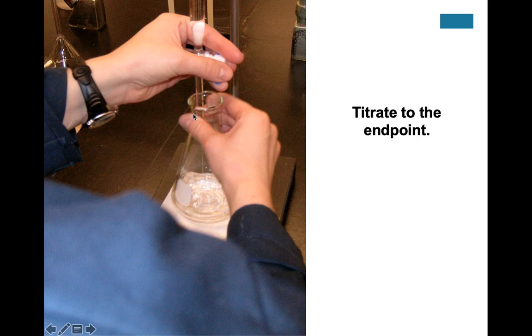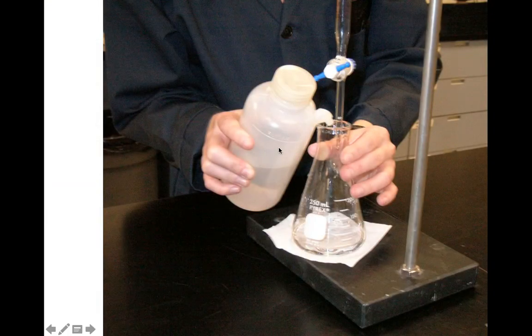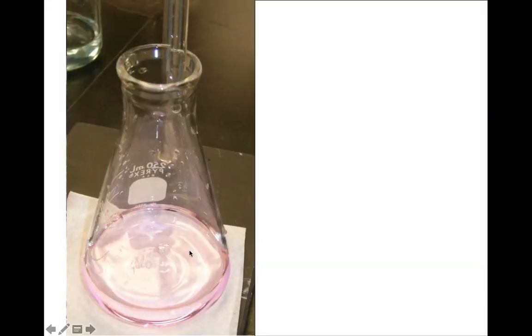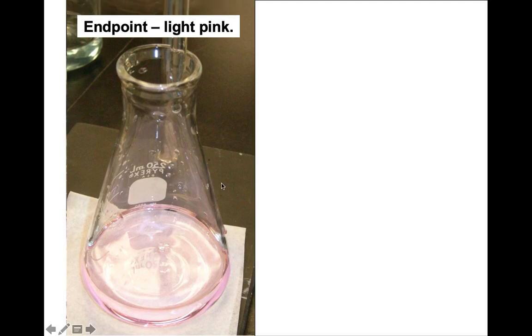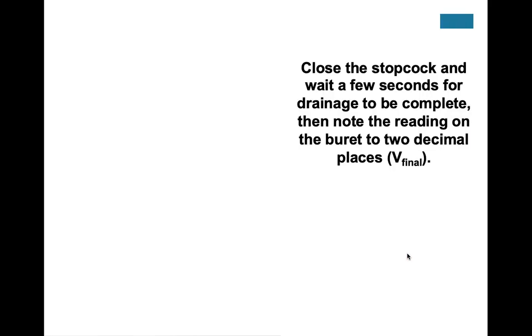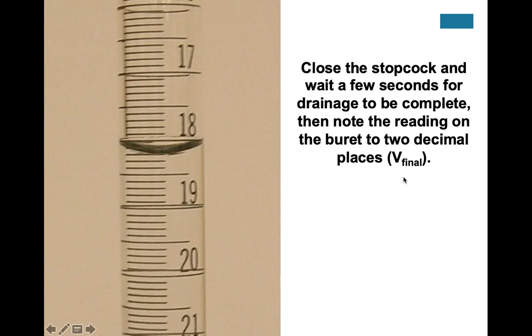And then if needed, you're going to add some distilled water, like it says here, from a wash bottle to rinse down the sides, just in case some of the base or some of the acid gets stuck to the side. We want to make sure that it all reacts down in the bottom. And then when we're close to the end point, we go drop by drop from the burette until we get that faint pink color, just like here. And then that's the end point, light pink. And then sometimes you over titrate, you go too far and you get dark pink, which is not what you want. And then we close the stopcock and then we wait.